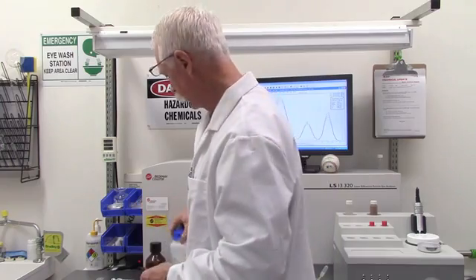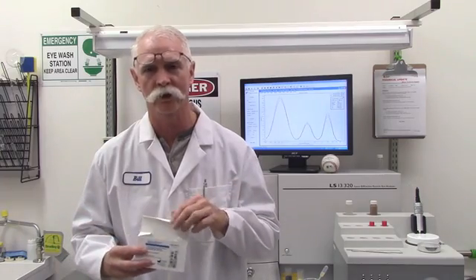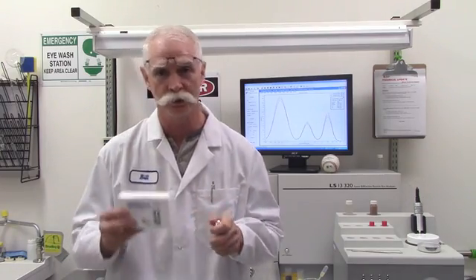Before you perform the sample preparation, it could be powder, maybe in a liquid form. Also, Beckman Coulter offers a nice selection of dispersants in both ionic and non-ionic form to help you disperse your material properly. Make sure, again, those particles are separated from one another to give a good measurement of the particle size distribution.